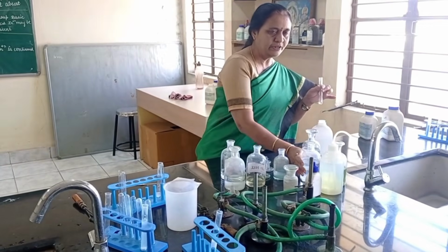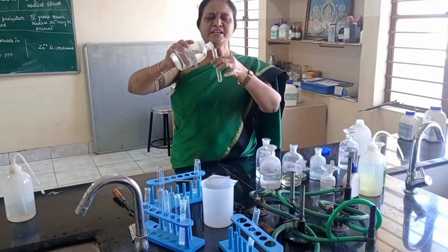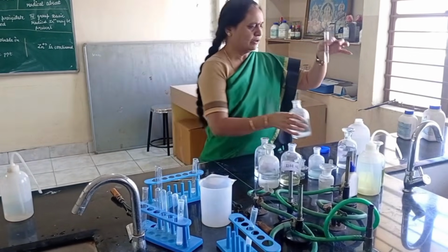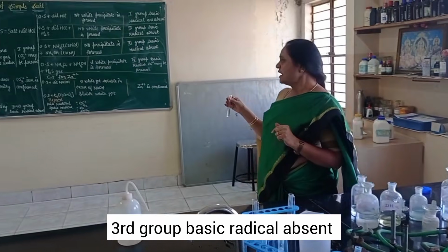See here, for third group basic radical, I take original solution, add solid NH4Cl plus NH4OH solution in excess. See here, no precipitate. So third group basic radical absent.